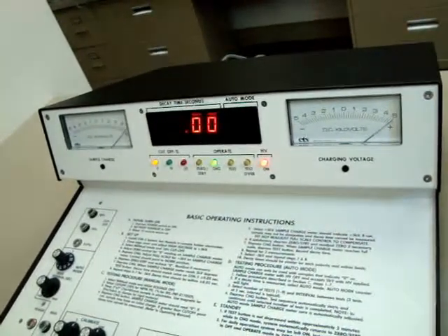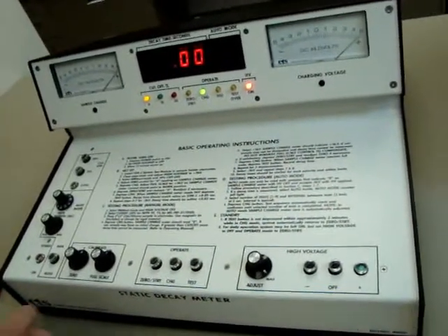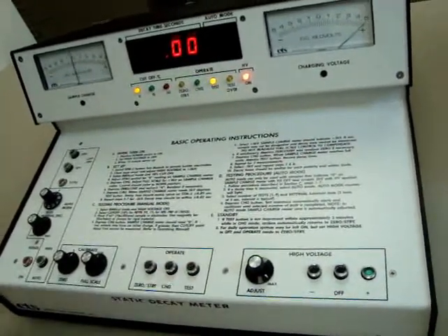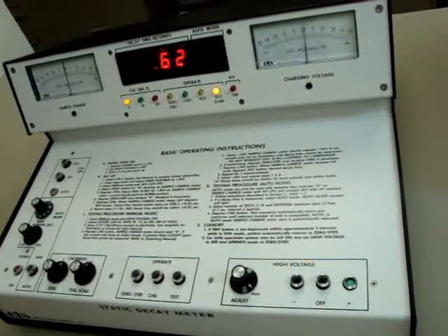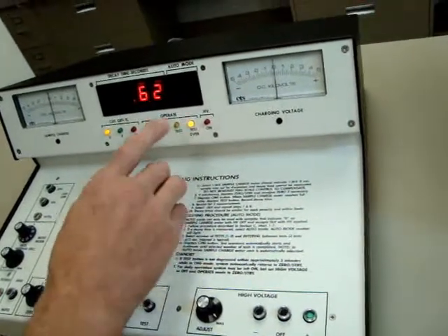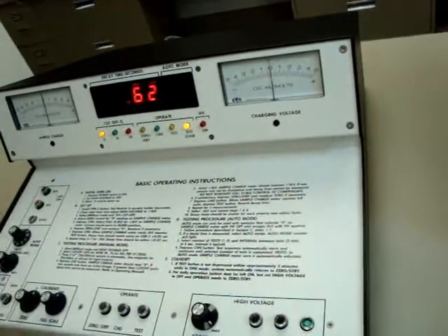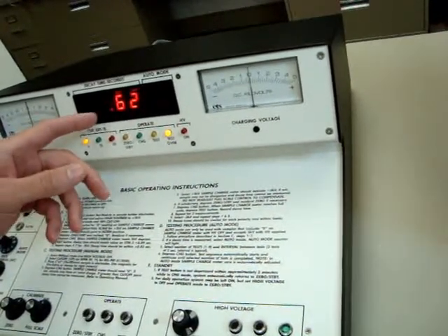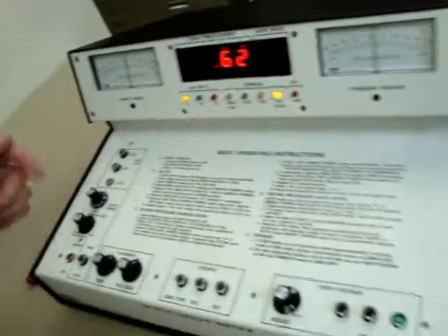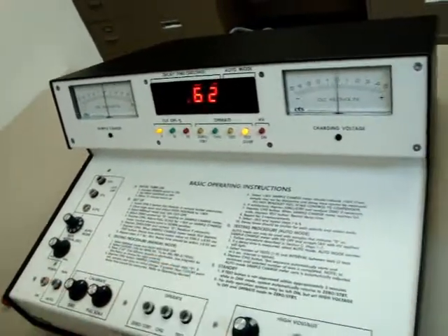Now we're going to actually run a test. We go back to zero standby, hit charge, and since we're in manual mode, we have to manually depress the test button. Notice when we hit the test button, the test LED came on right away, and then the test-over LED came on after it completed the test. In this case, it reads about 0.62 seconds. Our cutoff is at zero percent cutoff right now. So we just did an actual test of the unit.